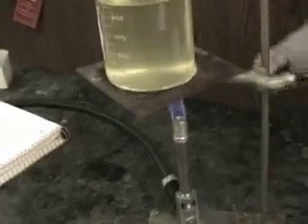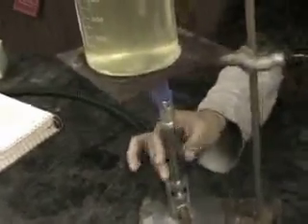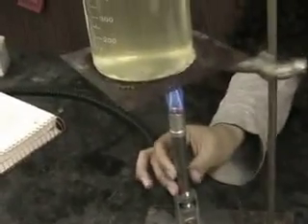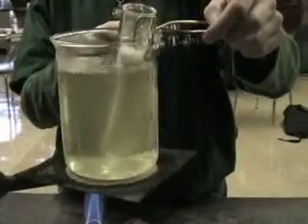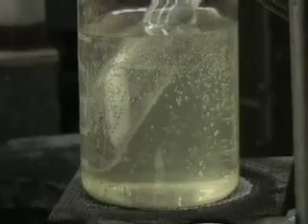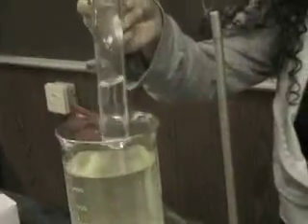First, we measure the freezing point of a pure substance. We measure out the pure substance on a balance so that we know how much we have. We set up a hot water bath to completely melt the pure substance. After the substance is in its liquid form, we'll allow it to cool while monitoring the temperature periodically.